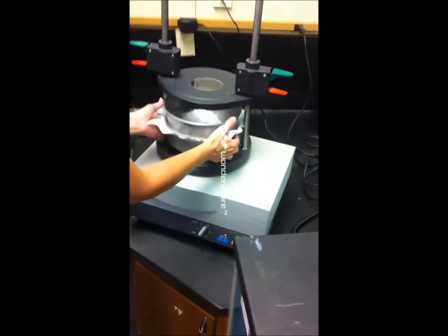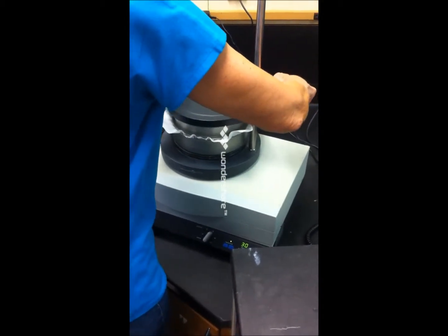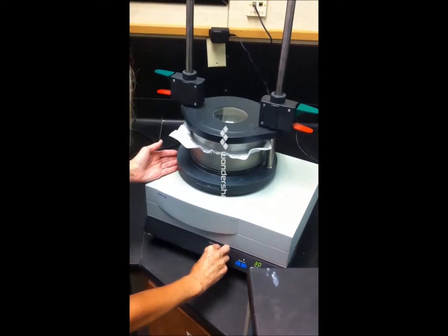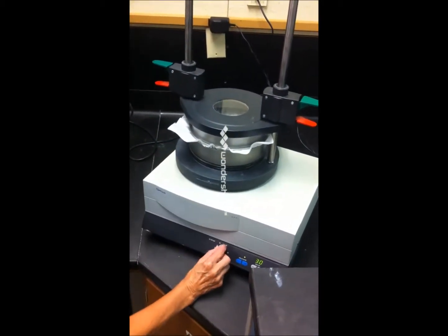And once again, she'll stick it in the machine, clamp it down, and we'll run this machine for 30 minutes. We will see how much of the talc powder has penetrated the quantum wear fabric.